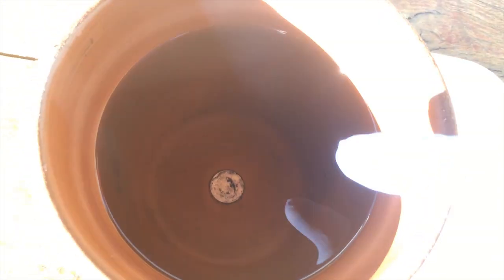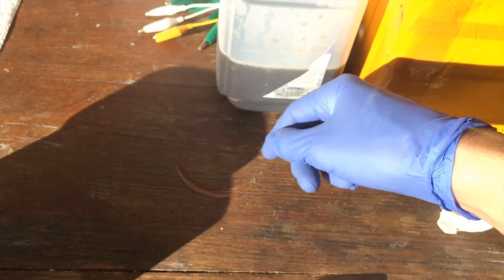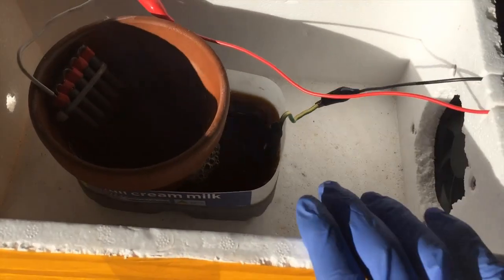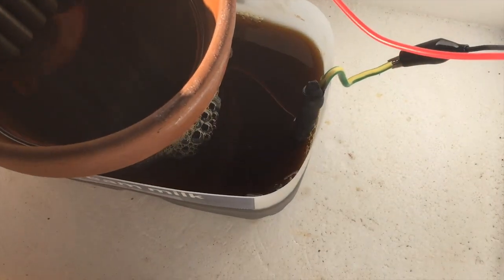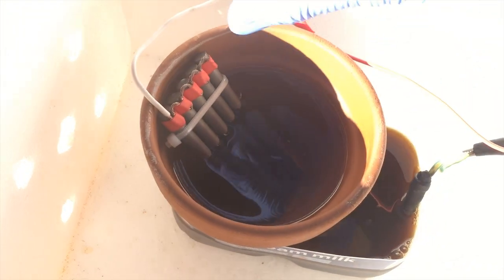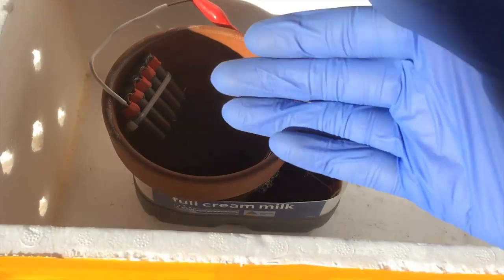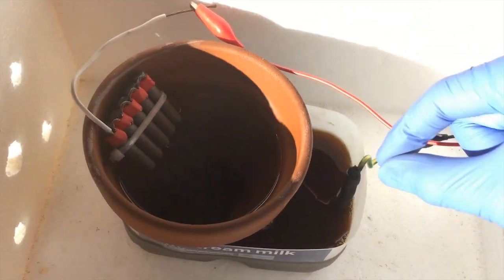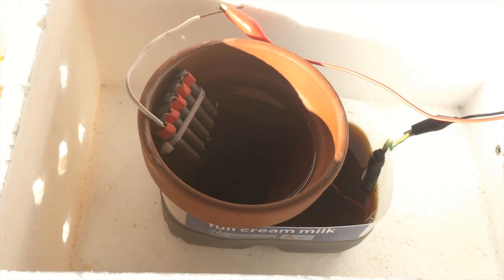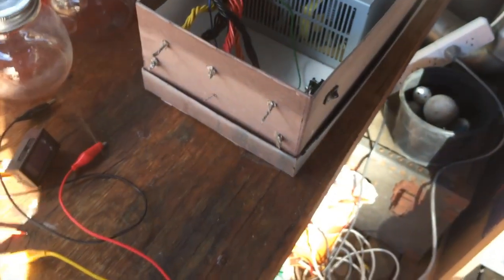I've already put water in the clay pot ready to make the acid, and we pour our grass-clipping solution into the cathode compartment. We've got distilled water in the anode compartment and graphite electrodes in each, ready to go — positive going to the anode, negative going to the cathode. The positive charge on the anode will drag all the anions across through the porous pot, split the water into oxygen and hydrogen ions, and generate acids.